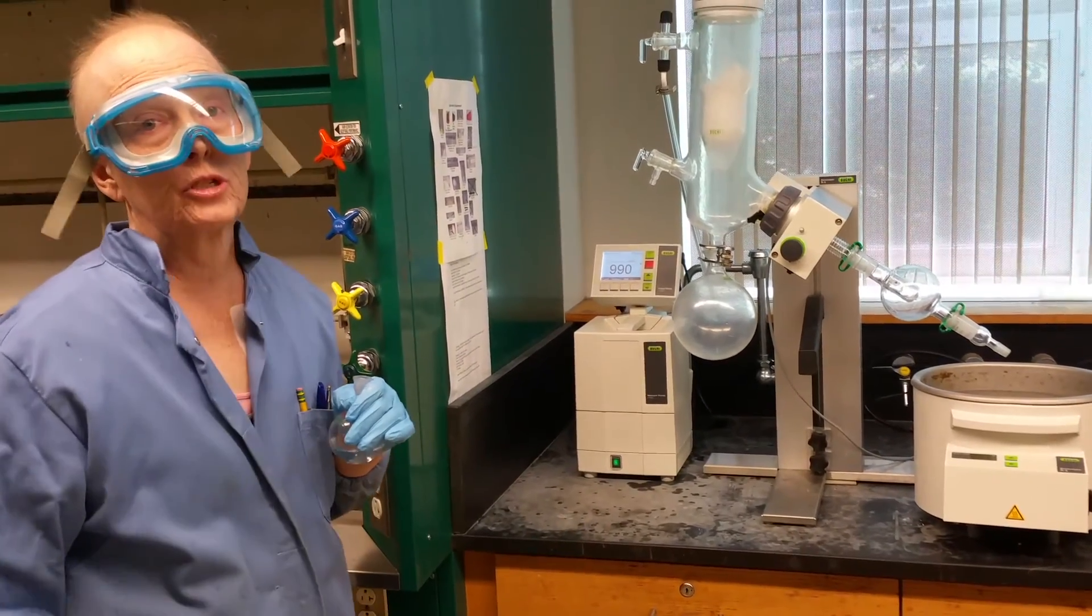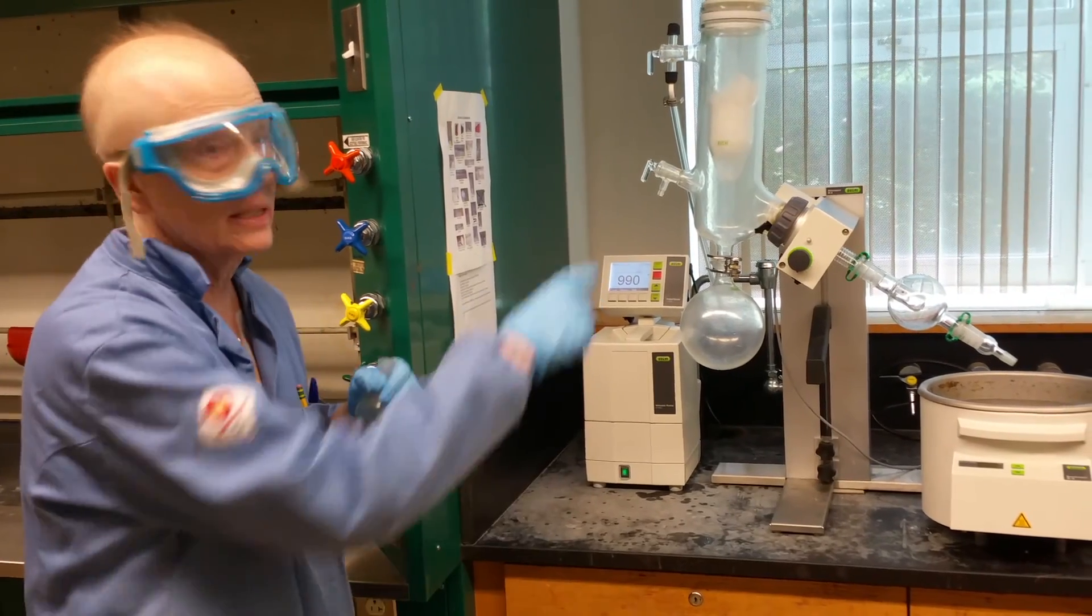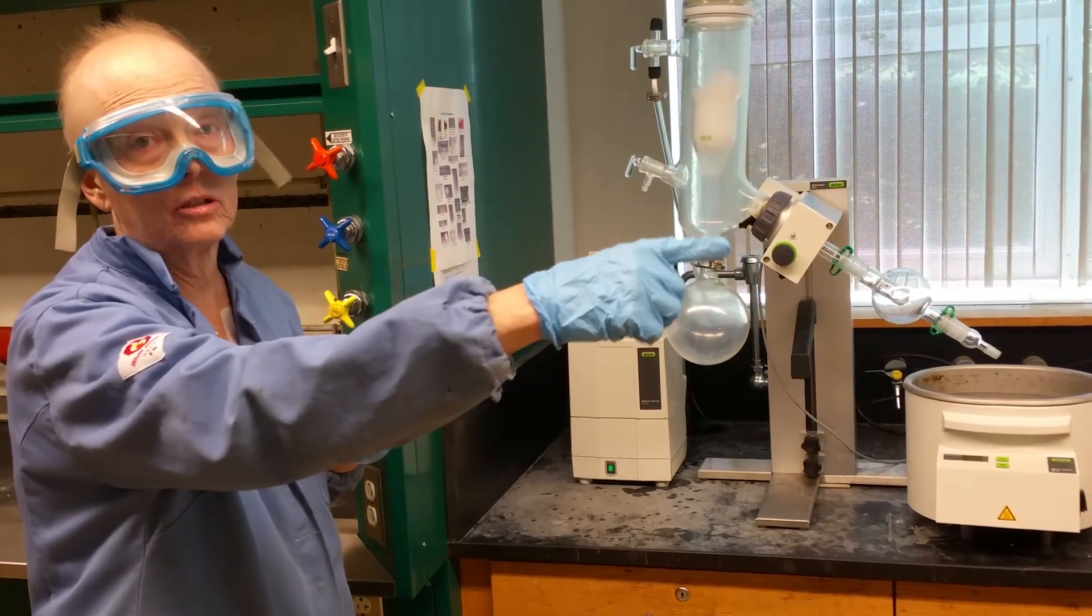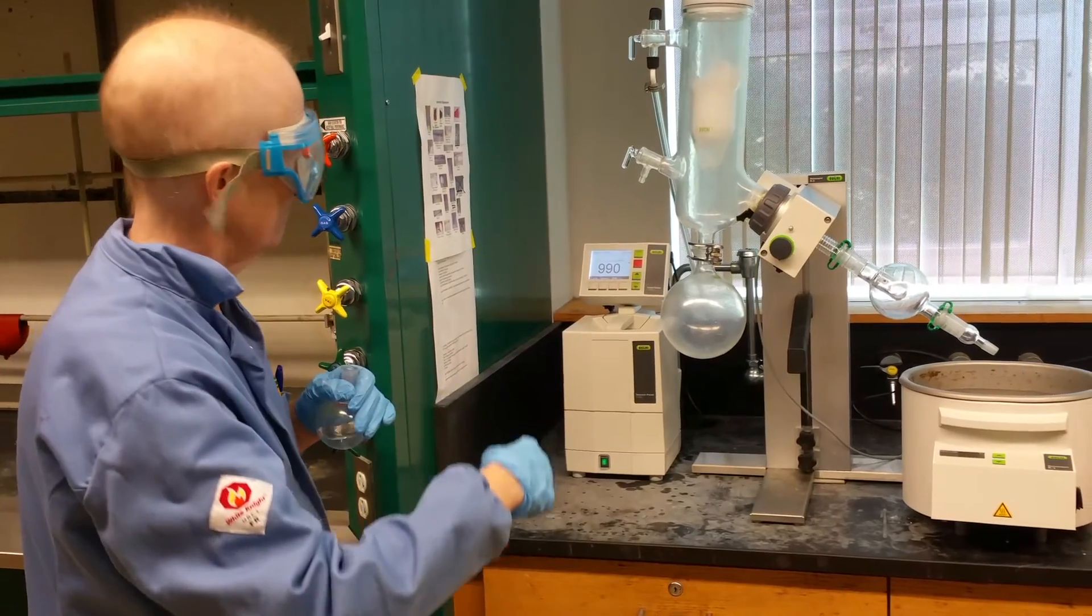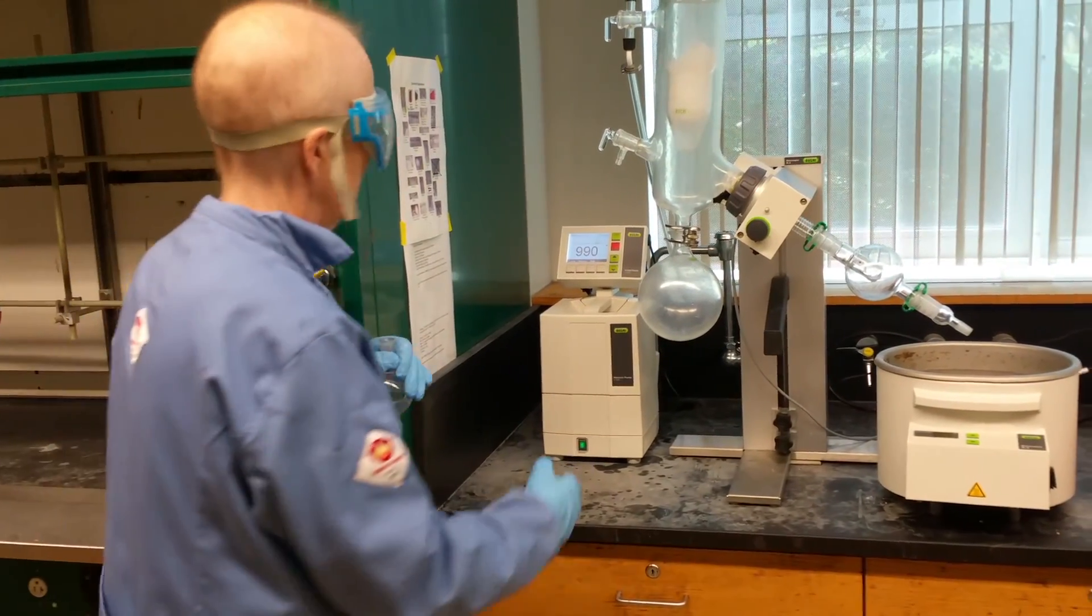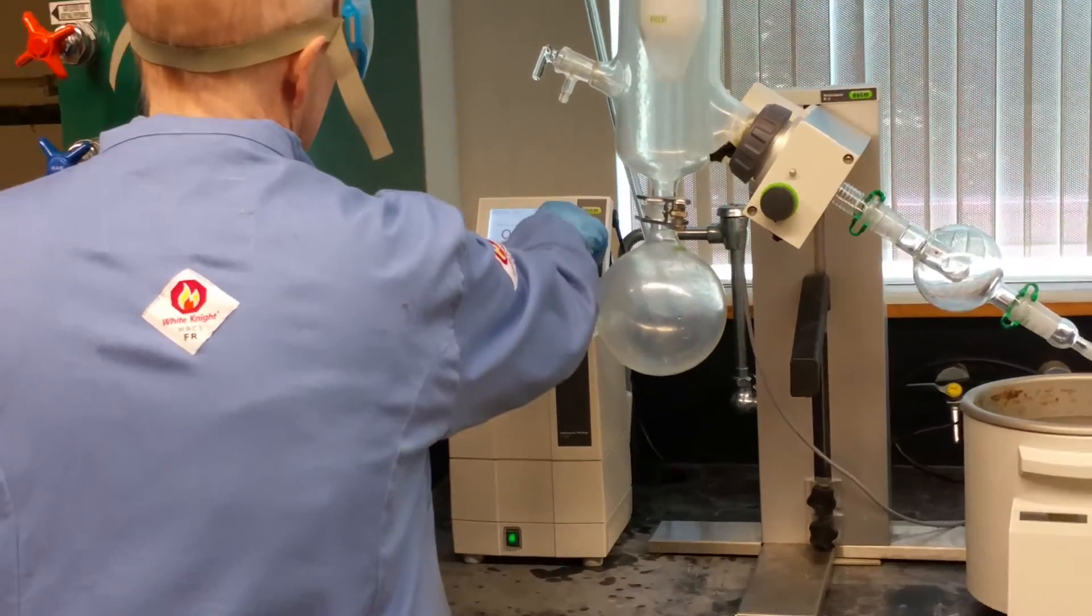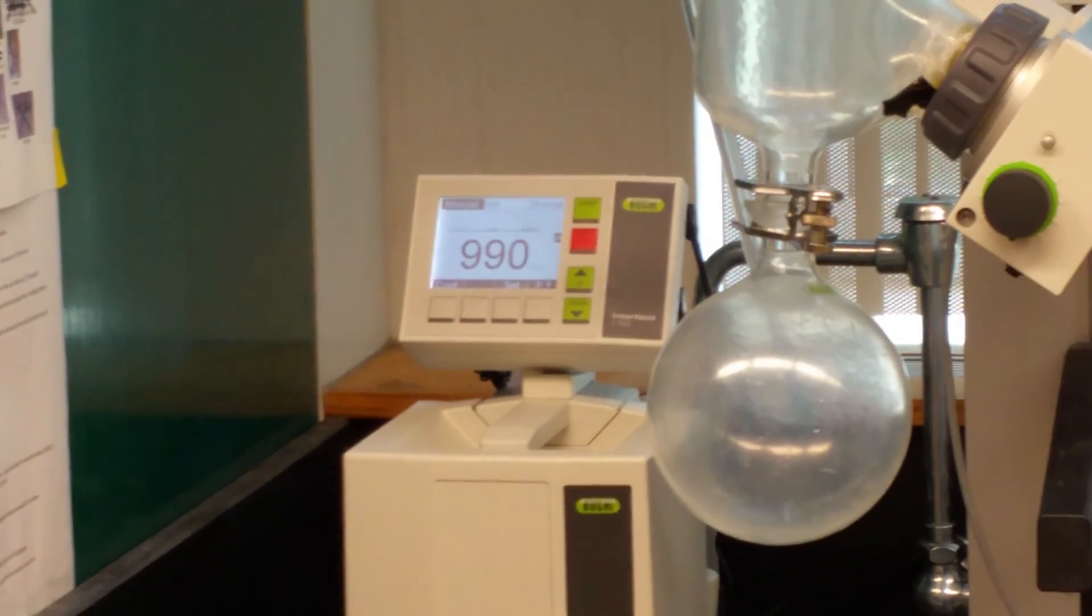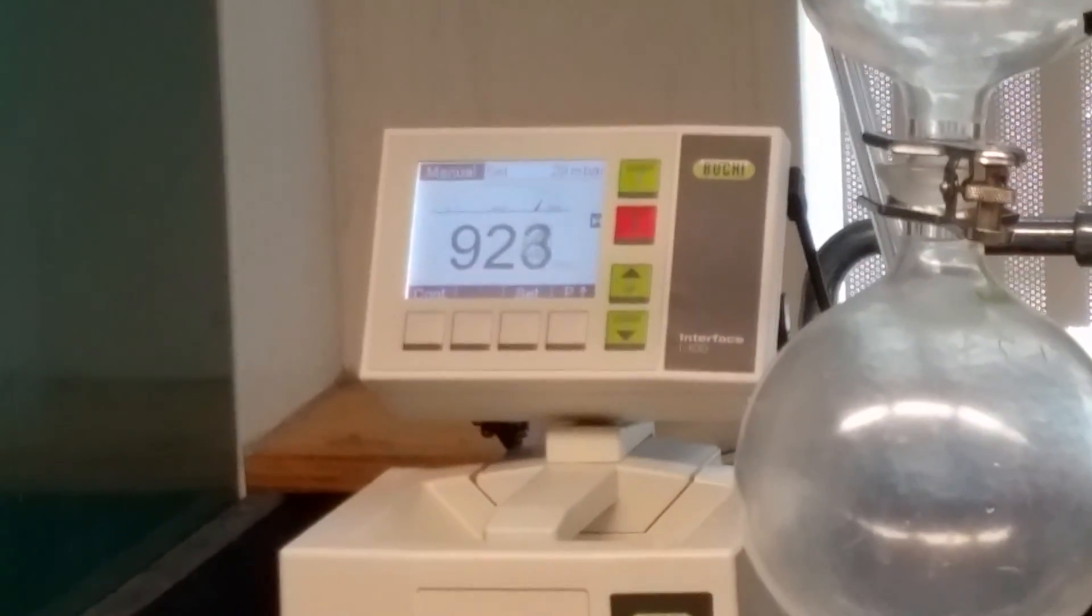Why am I dressed like this? Because I'm working with chemicals, and because this is going to be at reduced pressure, and apparatuses that are at reduced pressure can implode. It is a possibility. It's very unlikely, but it can happen. So these have a pump. The pump is going to reduce the pressure in the distillation system. All you have to do when you come in is just push the start button that's at the top. The pump will already be on.